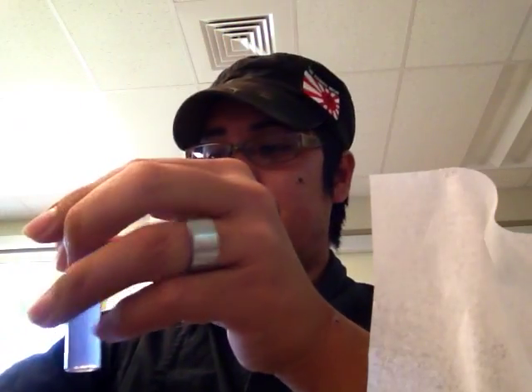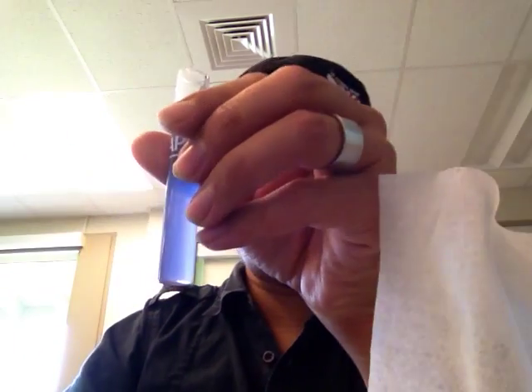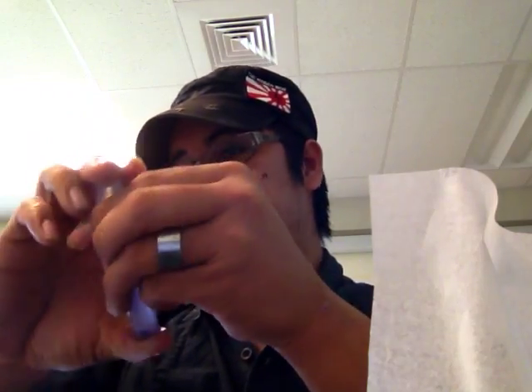It hasn't even turned pink. It's getting so much better. It hasn't come close to it. You don't want it to. Yeah, it probably was the bottle. I think so.